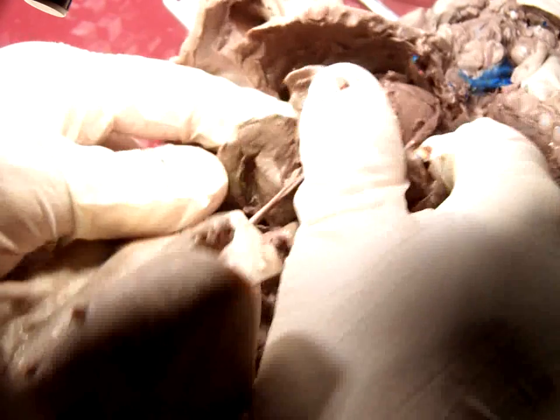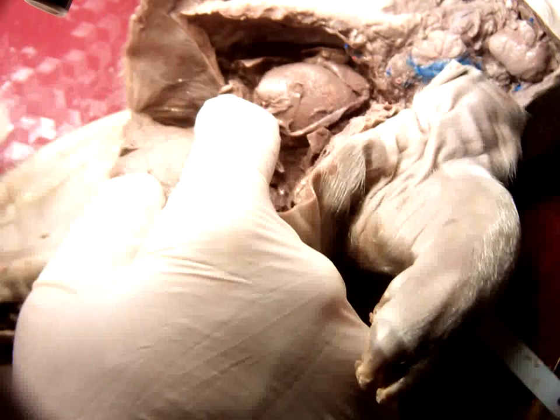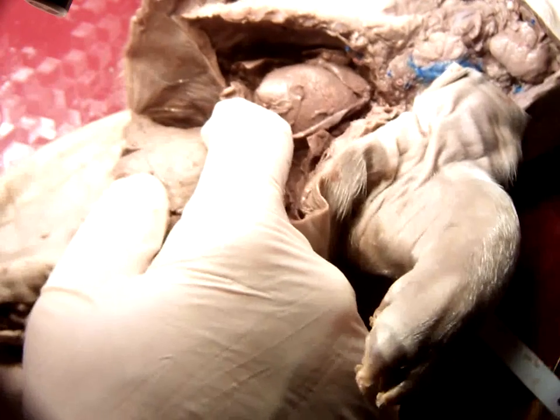And if we flip this up and look at the underside of it here, you should find a little bag-like structure there, and that is the gallbladder. On this guy it's right there. Most of the other ones it's a little bit bigger, but in every one I've seen it's attached to the underside of the liver itself. So if you peel that back, you'll find it, but it's this little bag there.